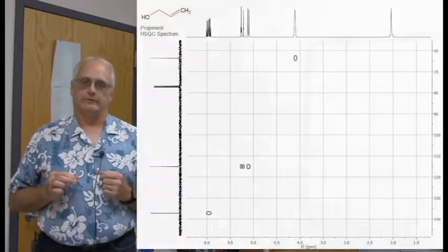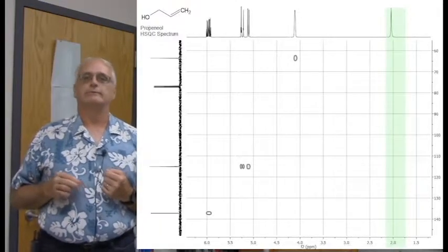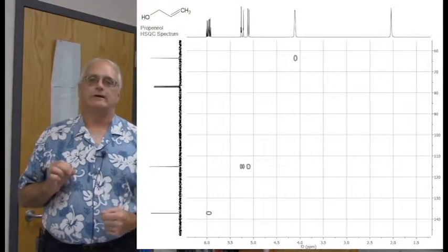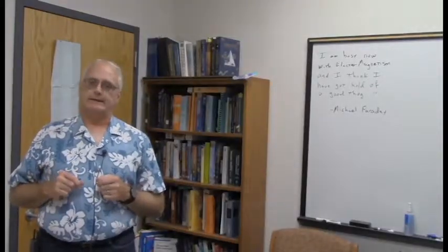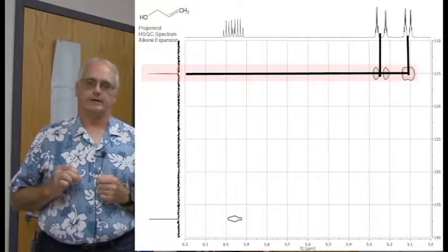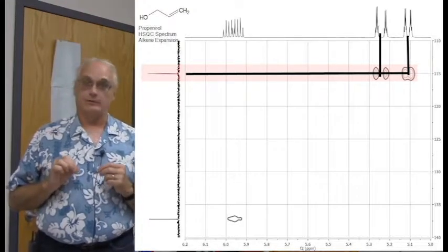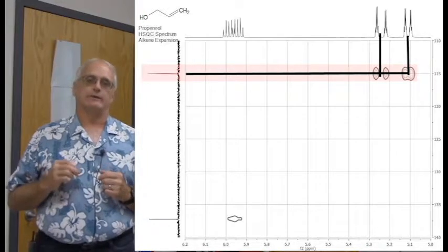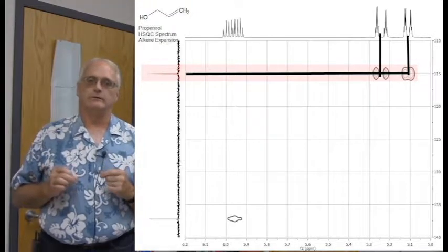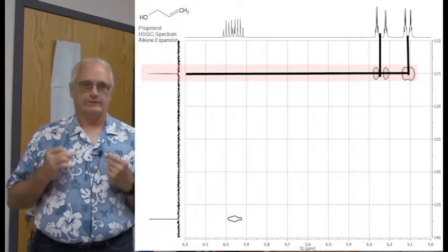So here's the full spectrum, and you can even see here that the alcohol proton has no correlations. It's a proton not on a carbon, it's on an oxygen in this case. But of course our focus is not the full HSQC, it is on the alkene region. And when we look at the alkene region correlations, there it is at 115 ppm, carbon correlating to the 2 protons beautifully. And in fact, even though the HSQC spectrum technically is a considerably lower resolution spectrum than the proton or the carbon spectra, two-dimensional spectra are just so large that we usually sacrifice some resolution. That 18 Hertz coupling constant is so large that we see the crosspeak actually in its doublet form.